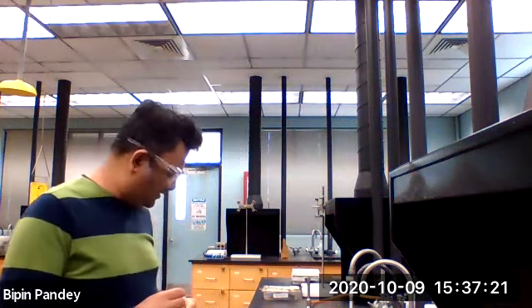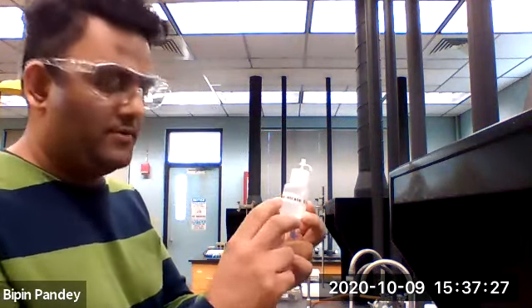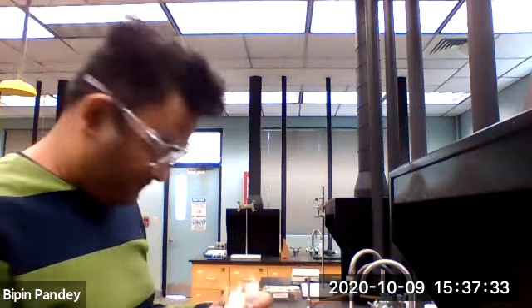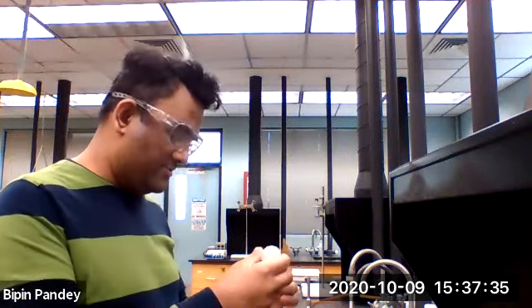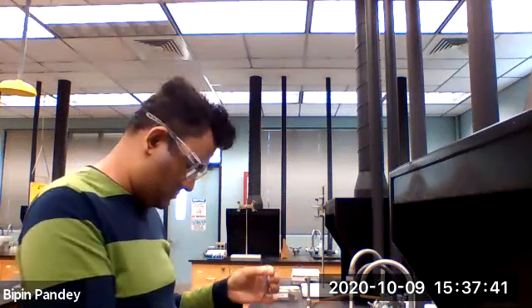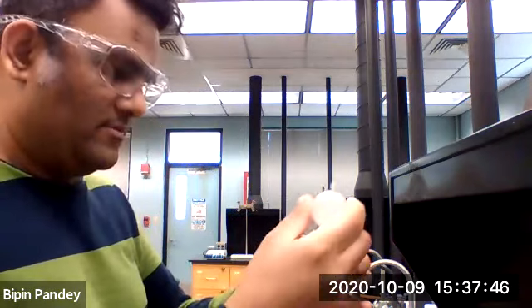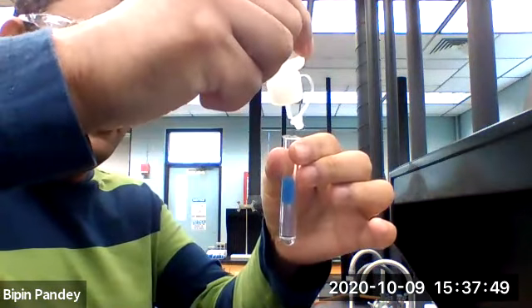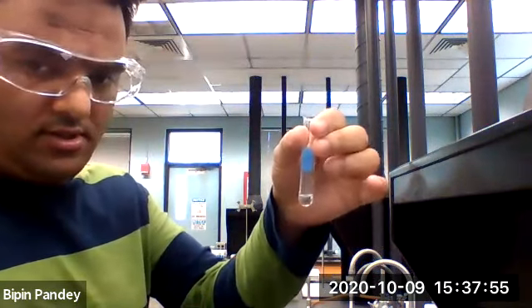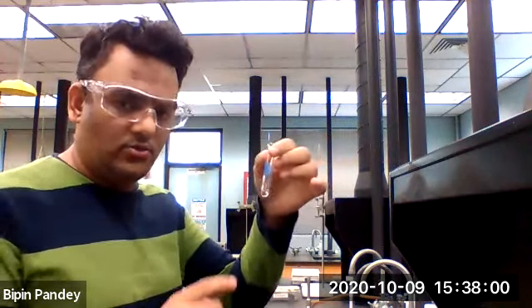Let's move on to reaction number 5. We are going to use sodium nitrate and sodium chloride. So add 5 drops, sodium chloride. So the solution is clear. Nothing is going on. There is no reaction in this case.